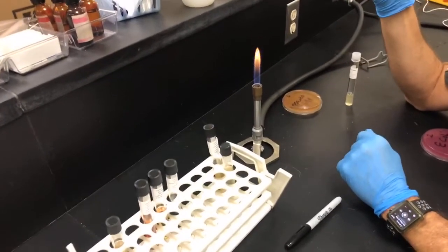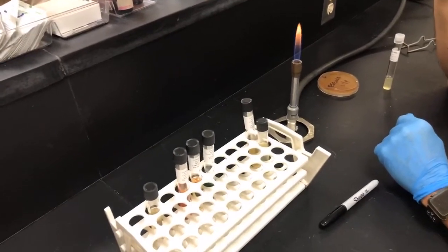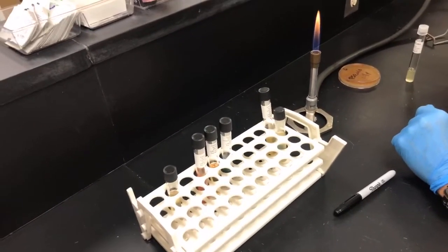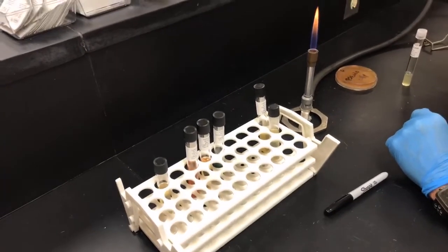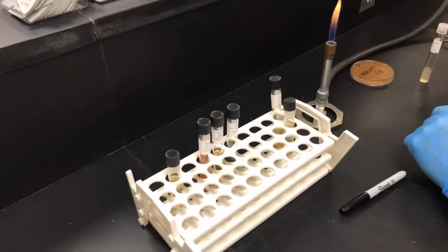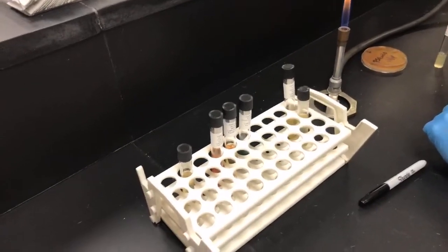Okay, so today we're going to be demonstrating the different biochemical tests and media that can be used to identify some differences in bacteria that you're not able to differentiate via staining alone. So we've got 4 different tubes that we're going to use, and this is all in the Enterobacteriaceae lab. And we're going to start with the SIM media.